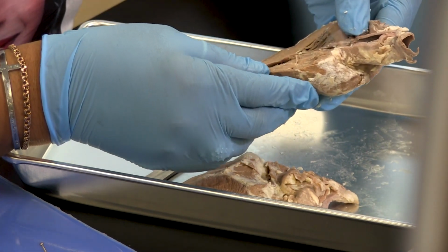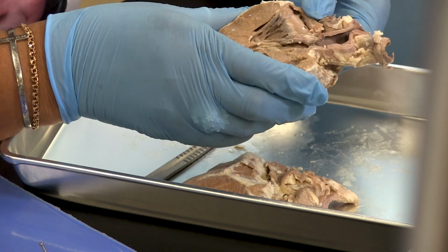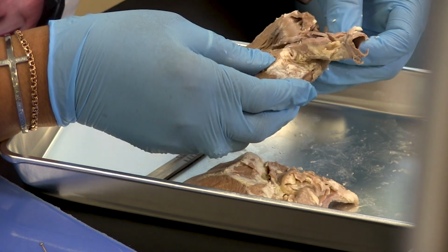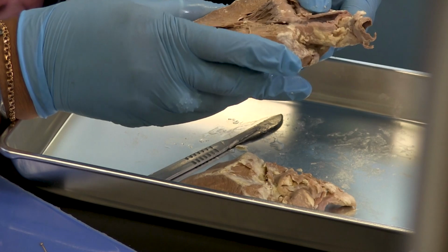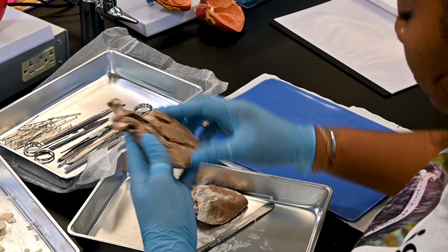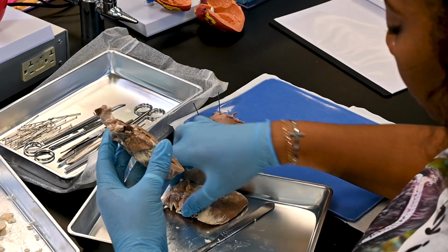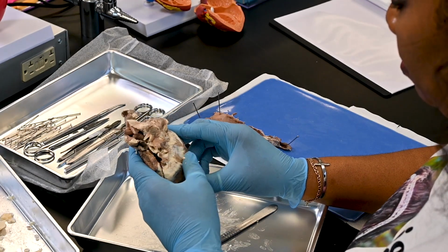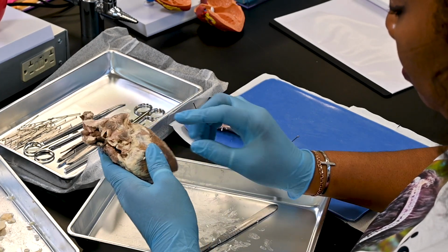This difference reflects the greater demand placed on the left ventricle, which must pump blood through the much longer systemic circuit, a pathway with much higher resistance than the pulmonary circuit served by the right ventricle. Hold the heart in its anatomical position with the anterior surface uppermost. In this position, the left ventricle composes the entire apex and the left side of the heart.